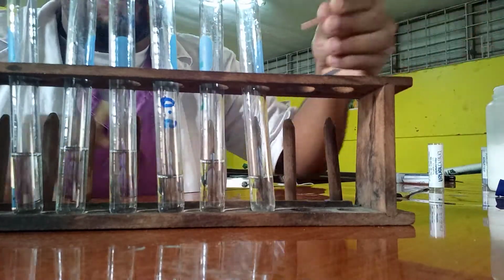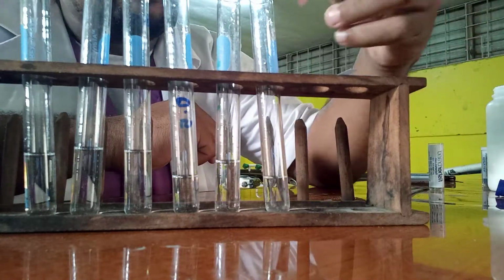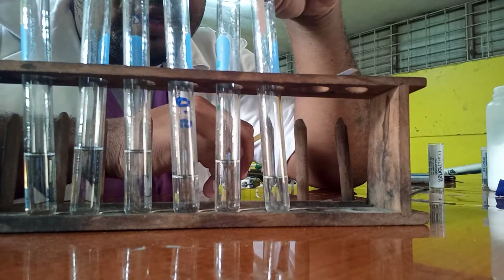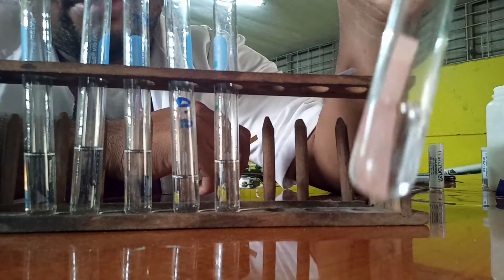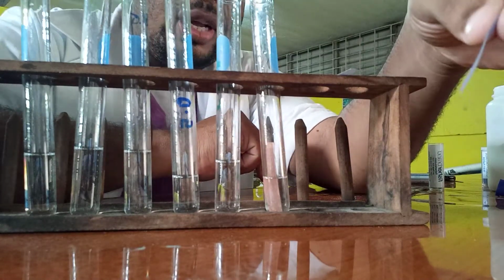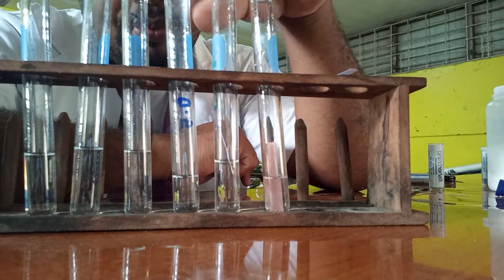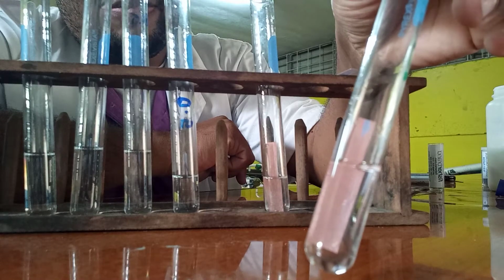We have the red litmus paper, and you should know, you're doing chemistry. So this is red litmus paper. If this is truly an acid, then you should know what will happen to the red litmus paper. So, if you notice, nothing happened. So, you should know if that is correct. Then now, I'm going to use my blue litmus paper again. You are doing chemistry, you should know what color change to expect. So there we go. That's blue litmus paper, change in color.